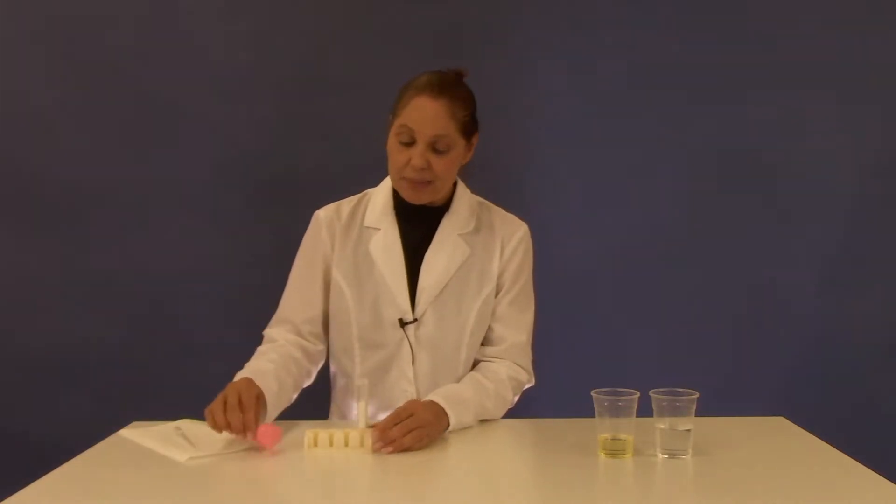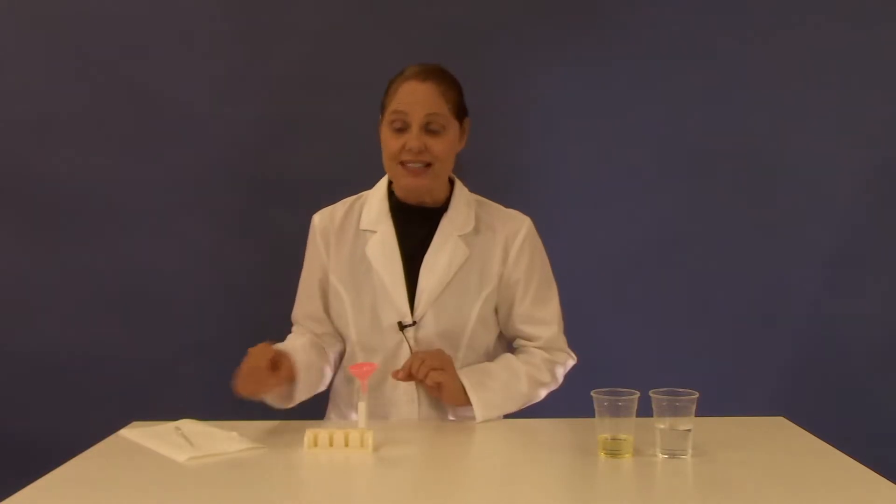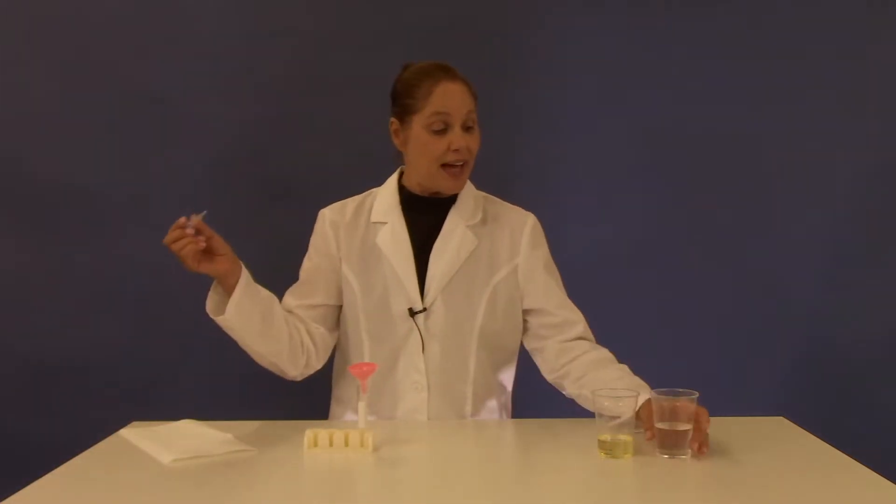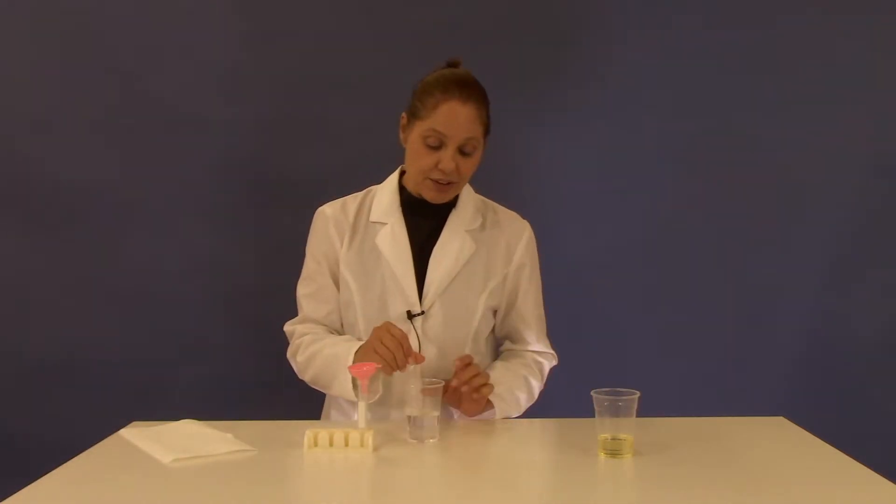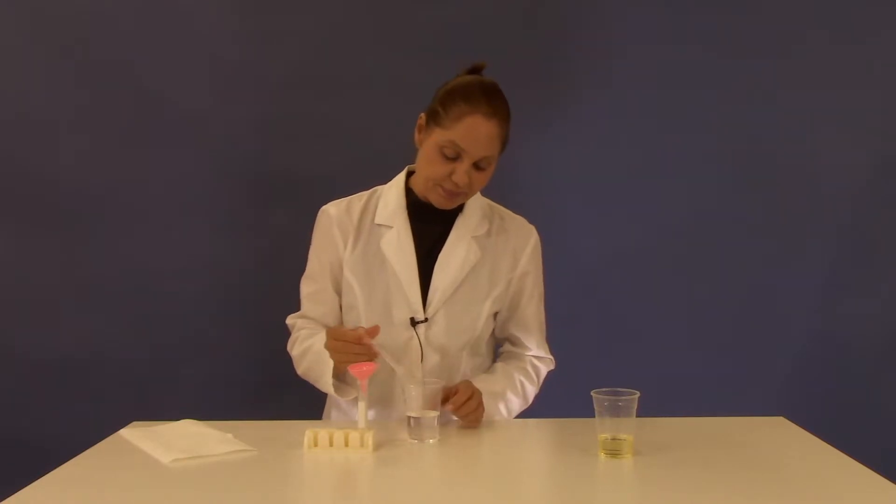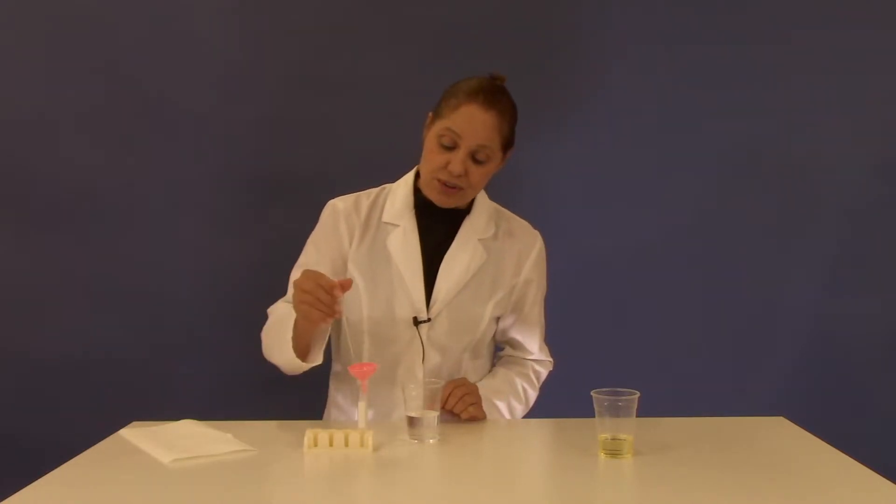Using the funnel, place it on top of the small test tube. And then with your pipette, measure five milliliters of water. Pour that into the test tube.